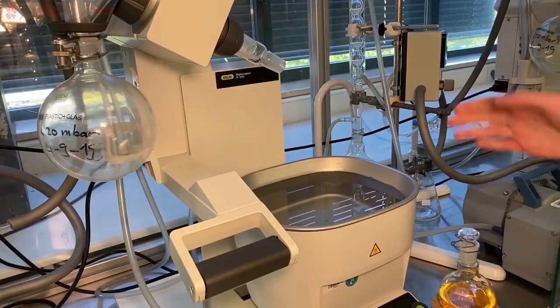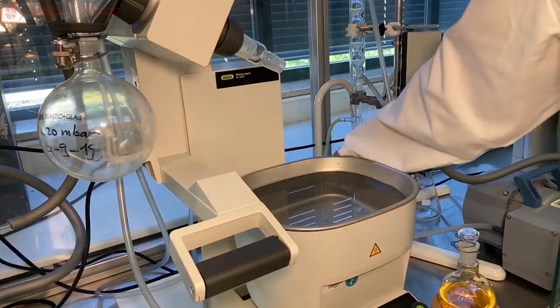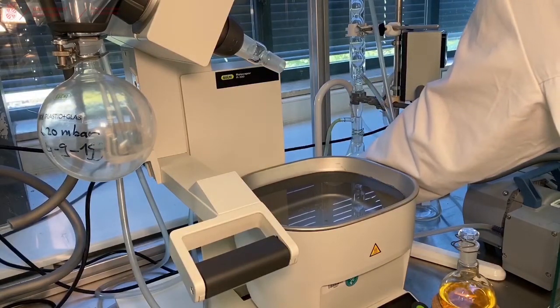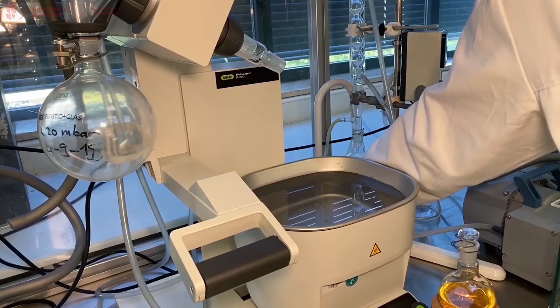First, you can turn on the water, which is generally in the back of the Rotary Evaporator. It could also be that this is already on, but always make sure to double check.